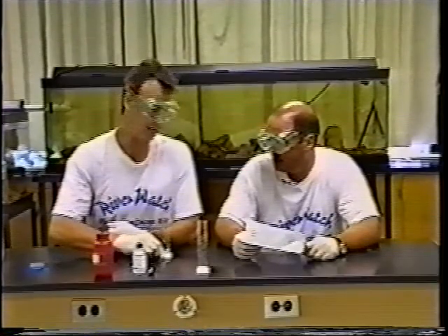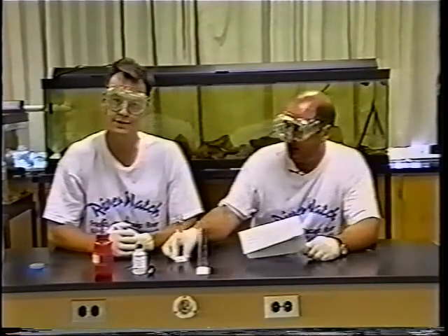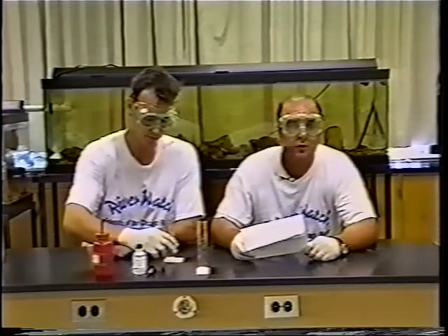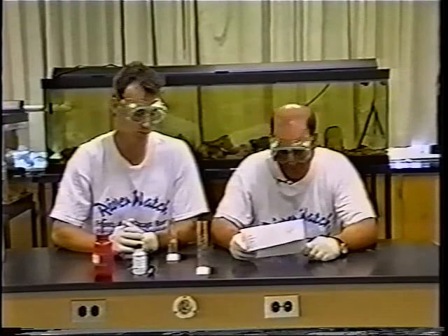As you do in a lot of tests, double-check and ask your partner to verify. Both confirmed they can see the black dot, so we can proceed with the 50 milliliter procedure. In some cases, after a really strong rain, the river could be so muddy that you'd have to use the 25 milliliter amount of water.